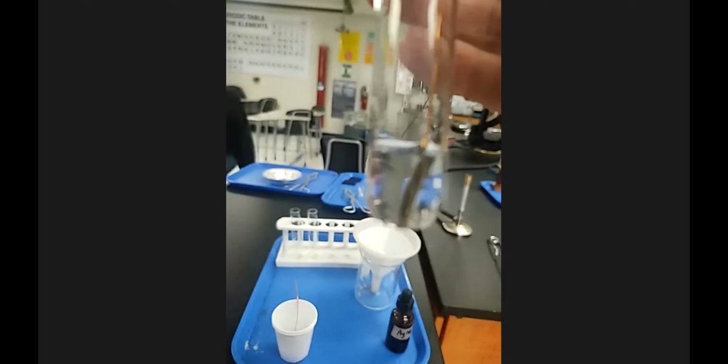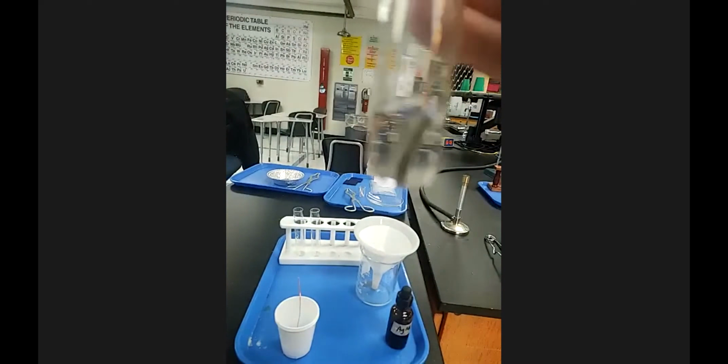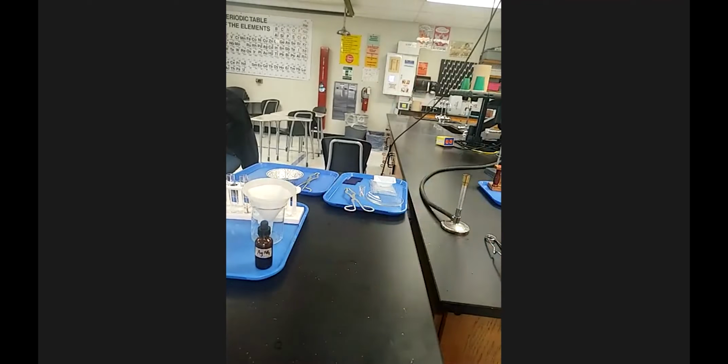It's alive. It's not really alive, but it's pretty. Get a really good, so like your eyes would just see it as, hold on. Trying to get that in focus, now it won't. Well, we'll come back to it, but it is very pretty. So that's station 1, before and during. The after can be any of the remaining times I'll show it to you.